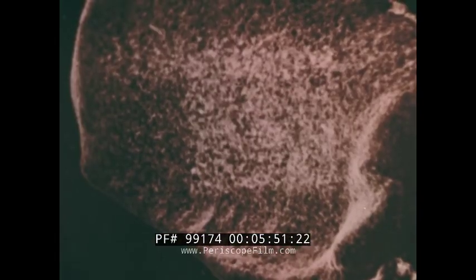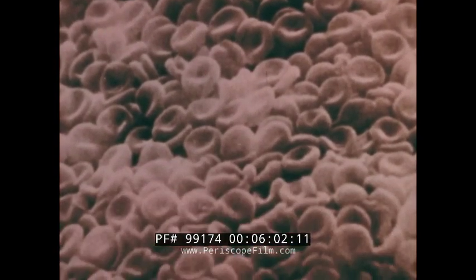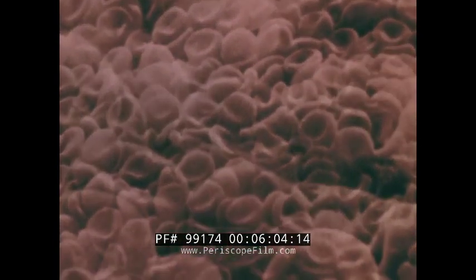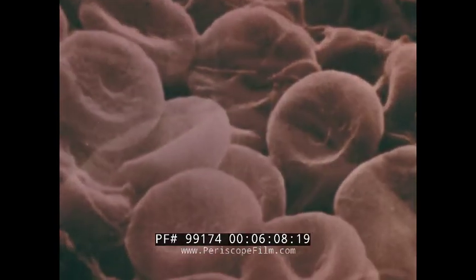Here is a whole human blood clot which has been fixed in formaldehyde for 48 hours. Now we have some idea at a glance of what a blood clot is really like. We can make out individual red cells enmeshed in bands of fibrin. Of course, we're still looking at the surface. How can we look inside?